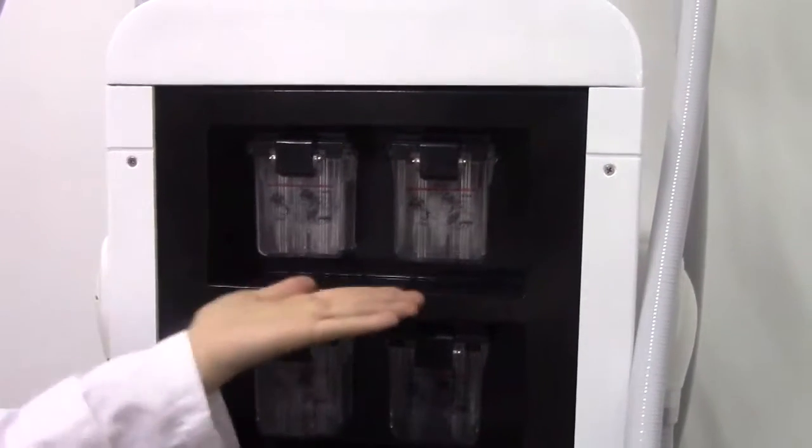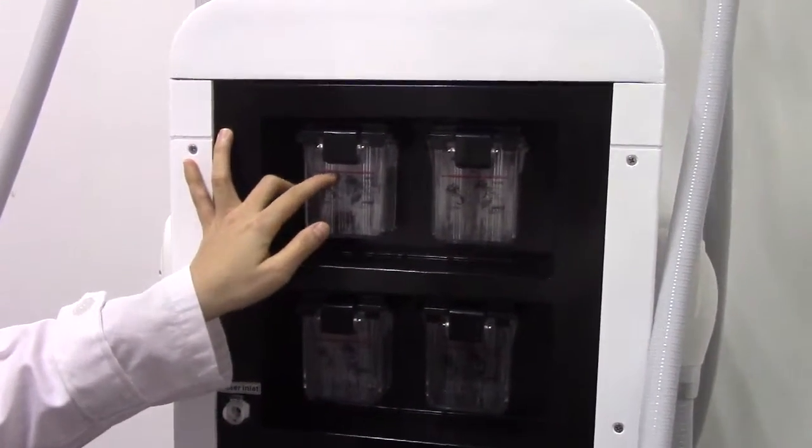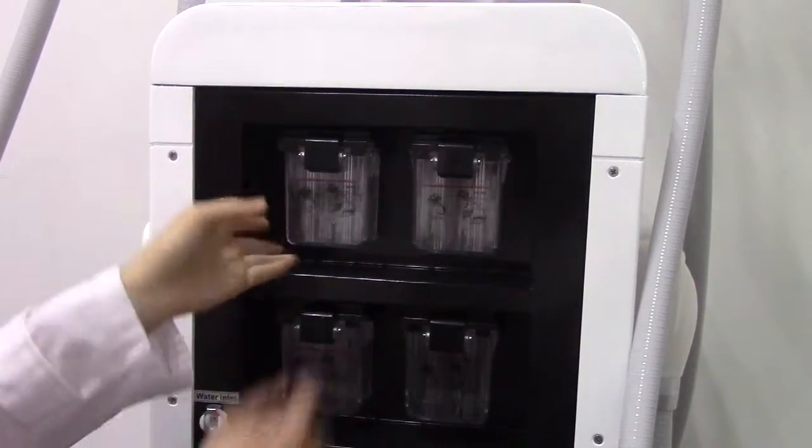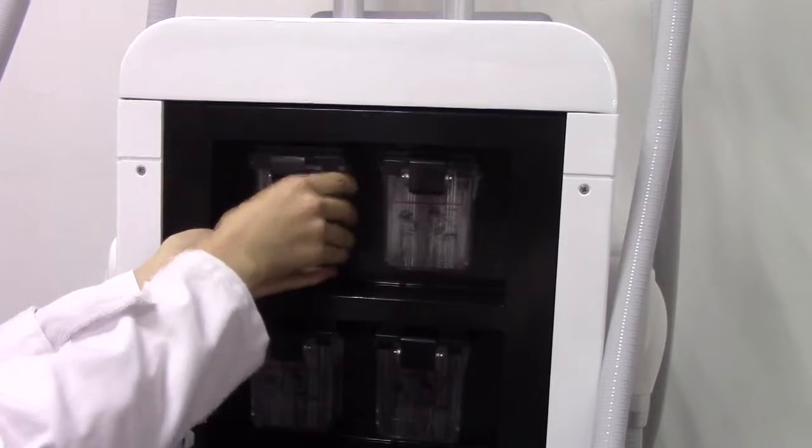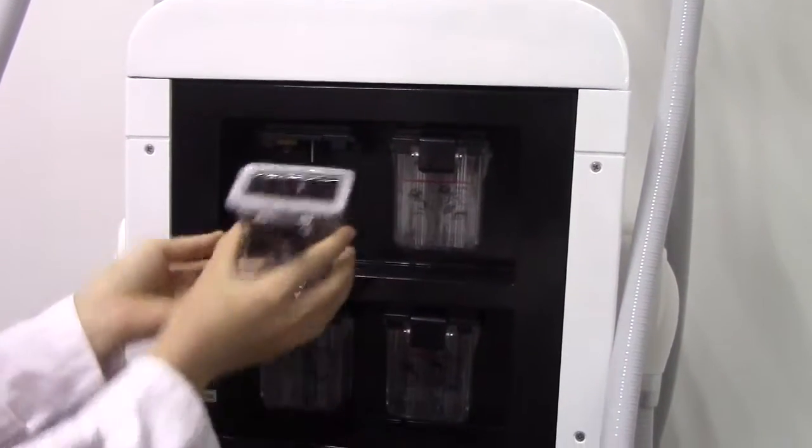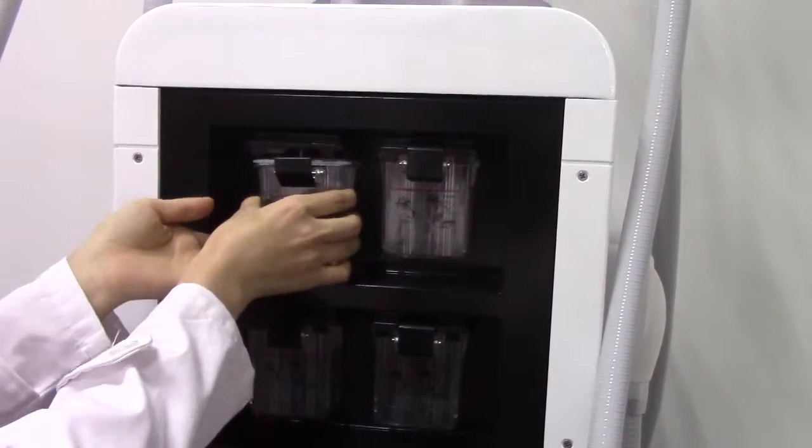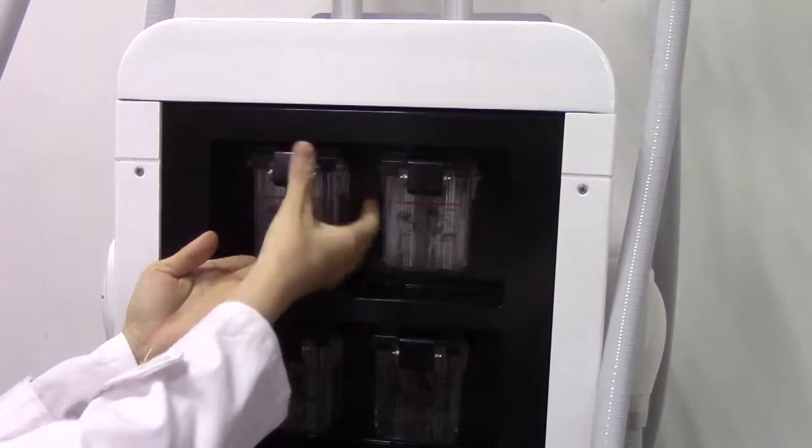These four bottles are the wastewater bottles. When the wastewater reaches this light, you have to pull off the water. Now we install it, directly match and push.